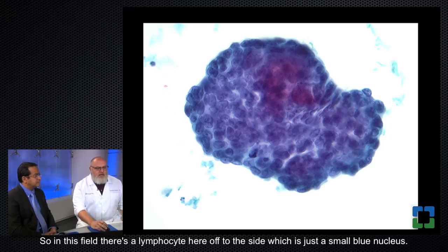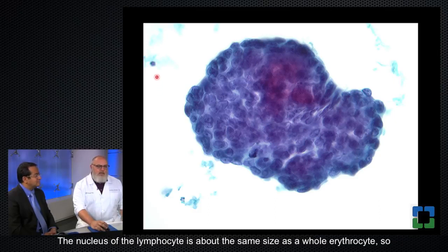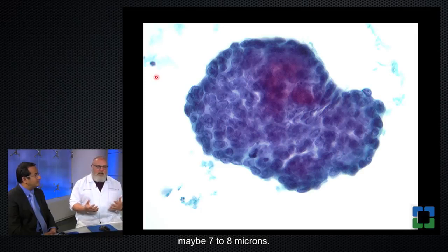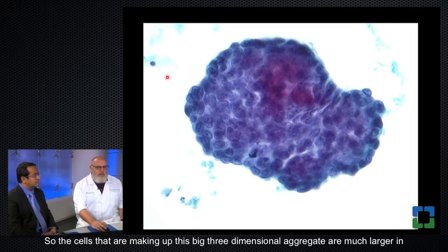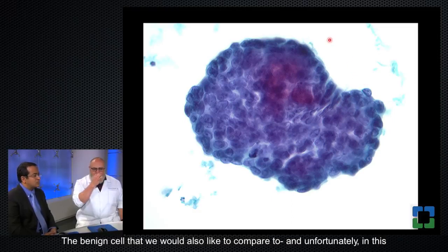So in this field, there's a lymphocyte here off to the side, which is just a small blue nucleus. And I think that's a great size reference. The nucleus of the lymphocyte is about the same size as a whole erythrocyte, so maybe 7 to 8 microns. So the cells that are making up this big three-dimensional aggregate are much larger in size than a normal cell.